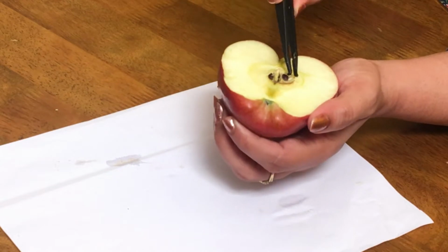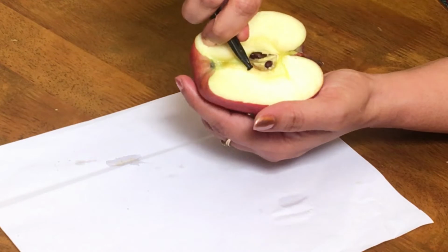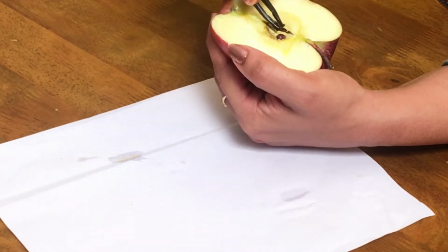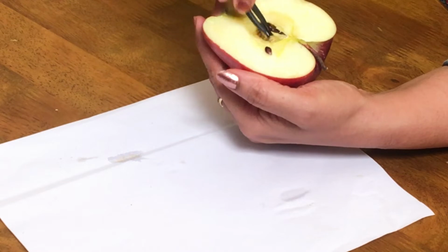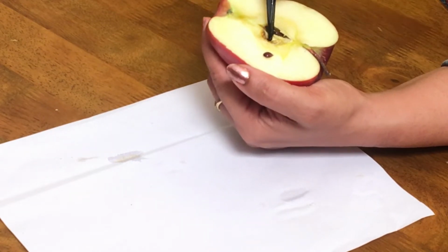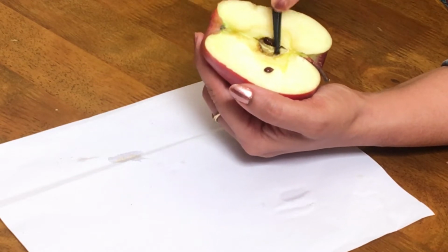This is the pericarp, and the inner endocarp is very thin and transparent. This part is the endocarp, and onto the endocarp you can find the seeds attached like this. These are the seeds, tiny apple seeds attached. So these structures are the endocarp, this transparent thin area.